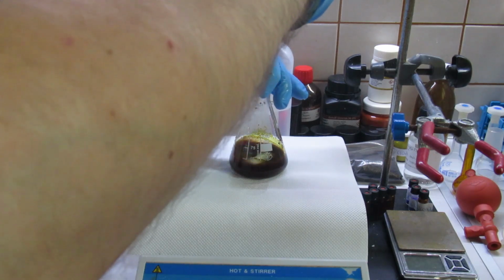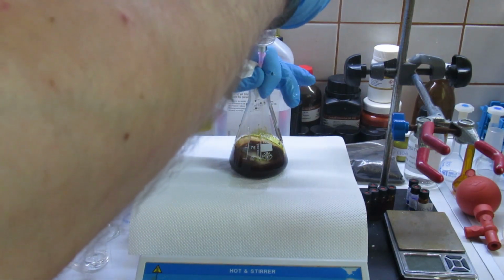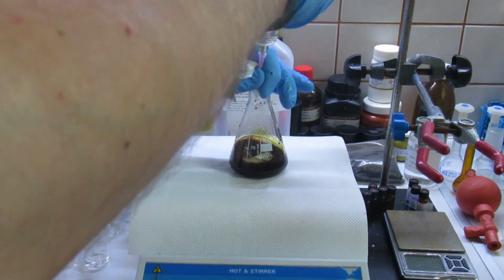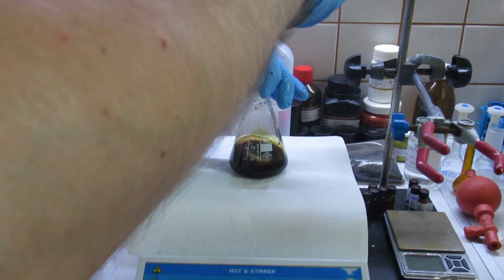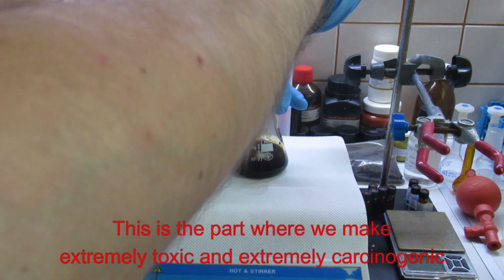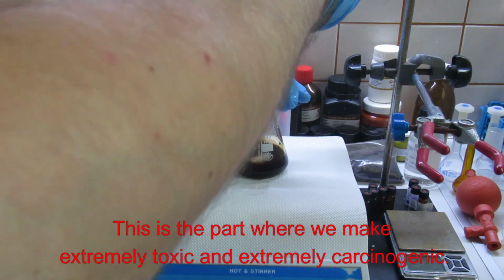Now this is the part where the cobalt is being oxidized from its +2 state to its +3 state.